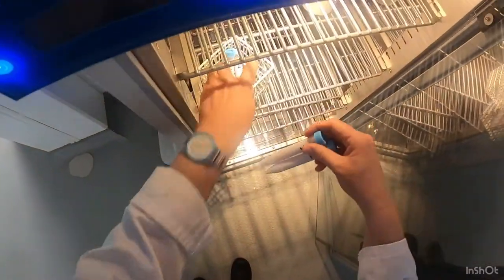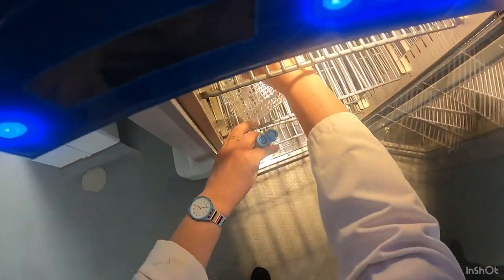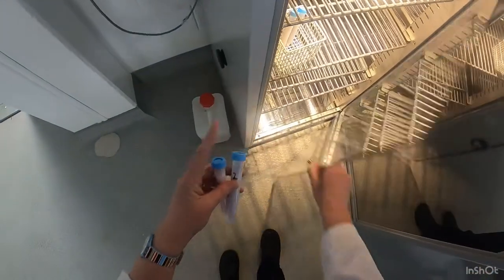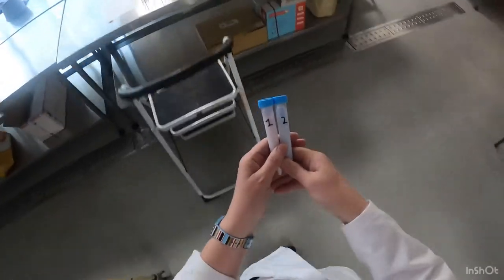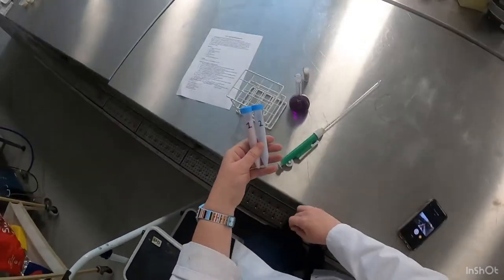Here we have sample 1 and sample 2 that I just put in 10 minutes ago.